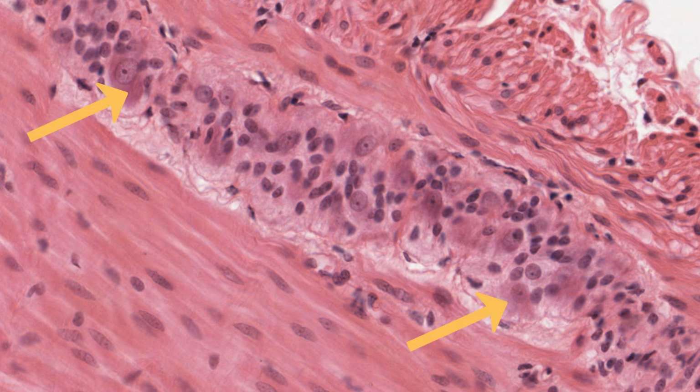Each ganglion cell body has a large pale nucleus and a prominent nucleolus and is surrounded by small satellite cells, which account for most of the cell nuclei of the ganglia. The ganglia communicate with one another by a network of non-myelinated axons which are difficult to observe with hematoxylin and eosin staining. This integrates the individual ganglia into a plexus called the myenteric or Auerbach's plexus.